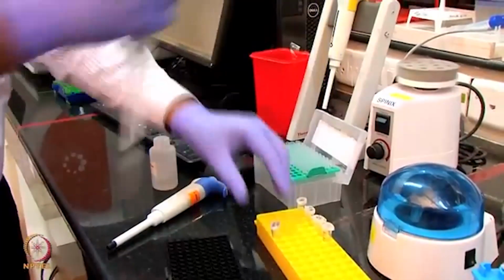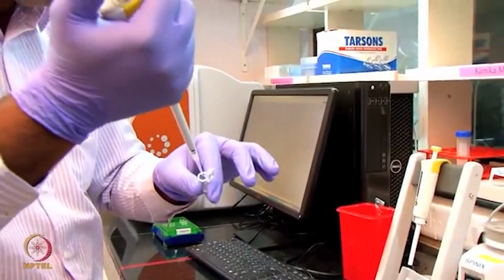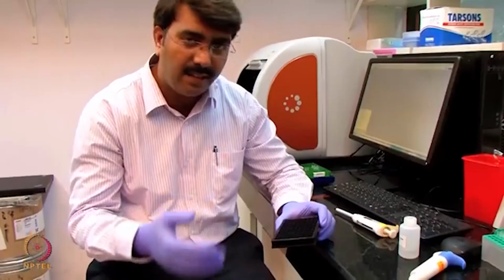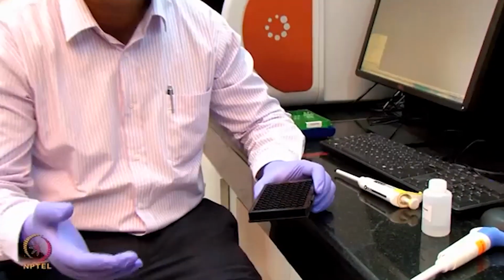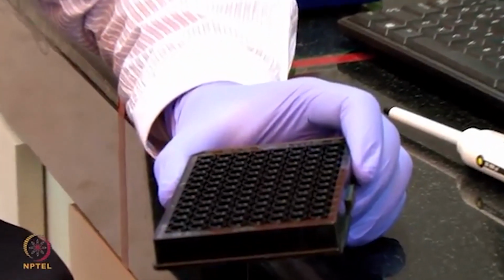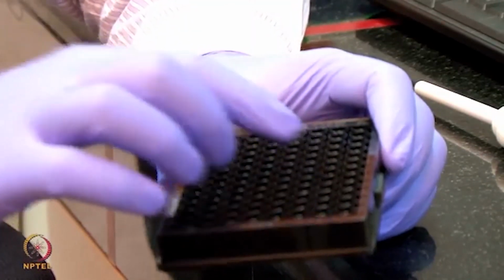Here, this is the 50 microgram per ml protein. I'm serially diluting, doing a two-fold dilution in the plate. So now we have made 6 concentrations of the standard apolipoprotein, with a concentration range from 1.56 to 50 microgram per ml. I put these standards from 1.56 in A3 till A8, which is the last, 50 microgram per ml. I also put a reference buffer, the buffer we are using for the reference subtraction, at B6, B7 and B8.